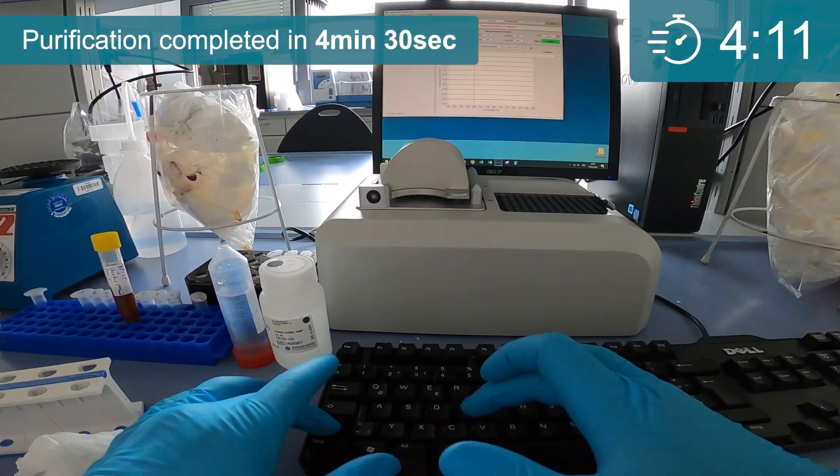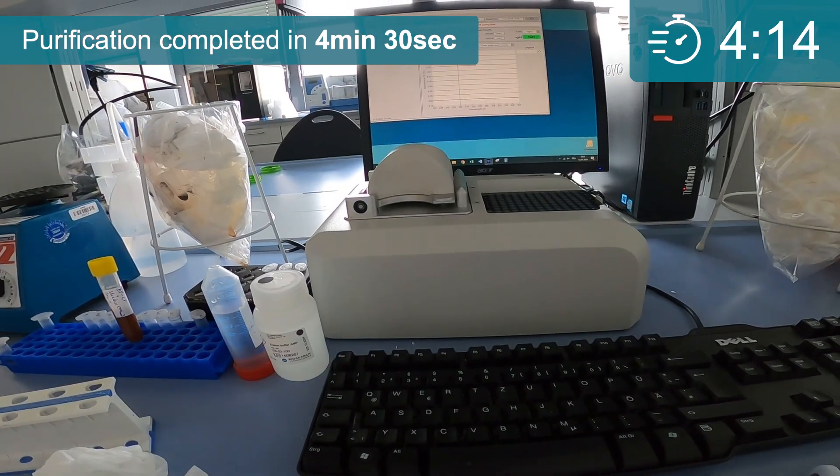There you have it. High quality, high yield DNA purified in under 5 minutes.